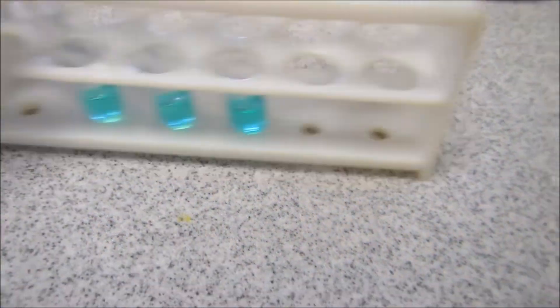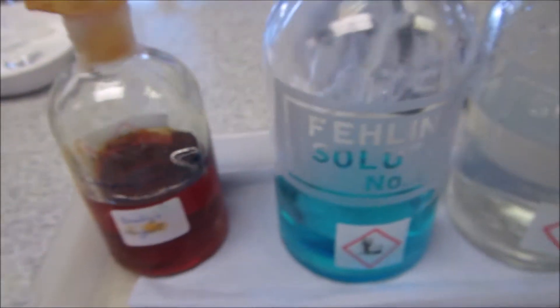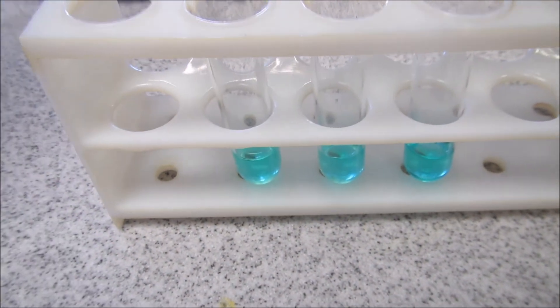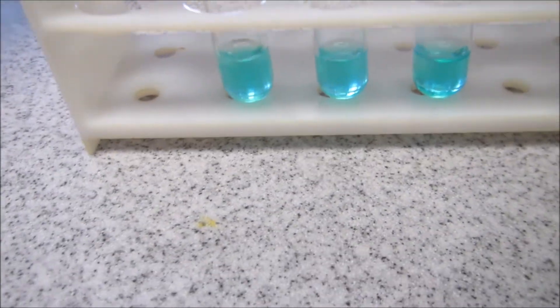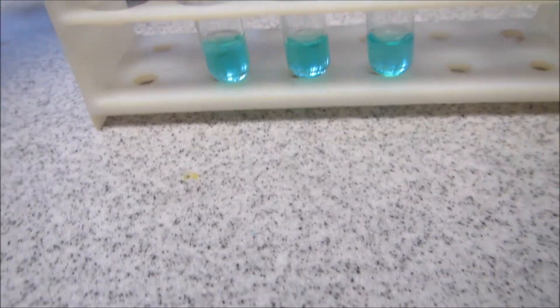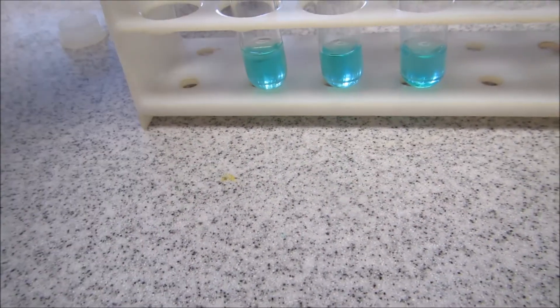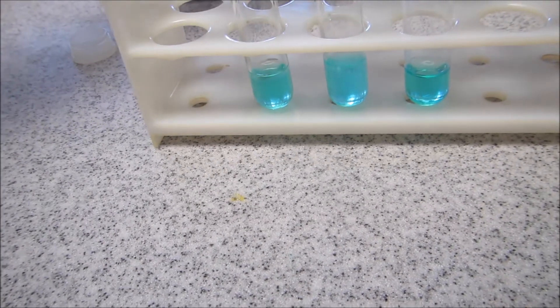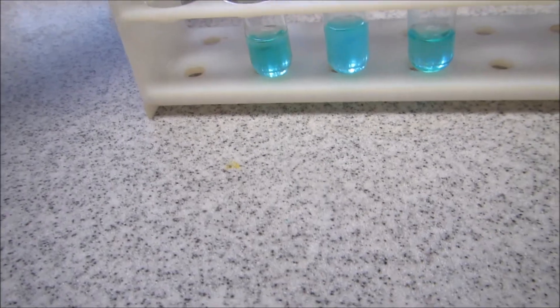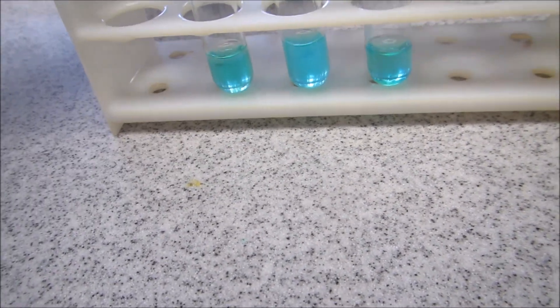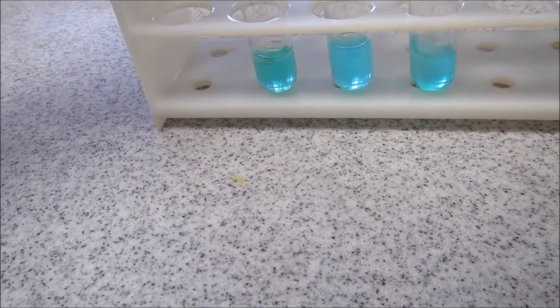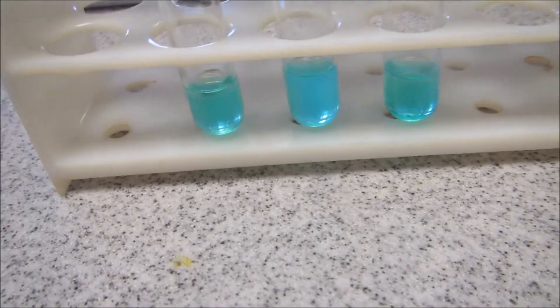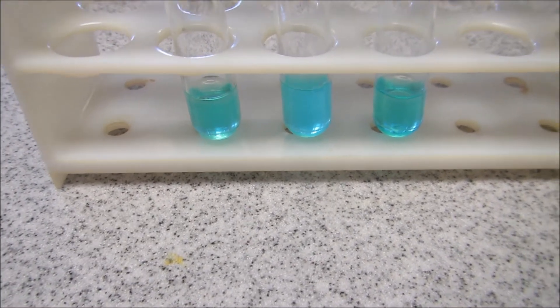Next one I'm going to do is Fehling's solution. So again, I'll add number three, number four, and number five. So what do you notice? There is a slight color change visible with one of them.